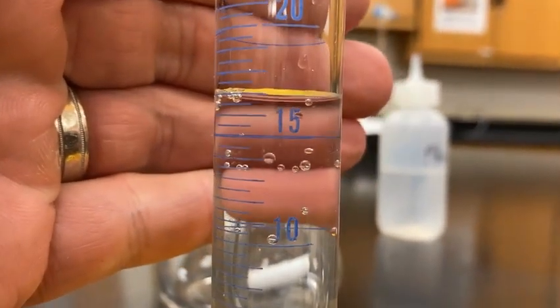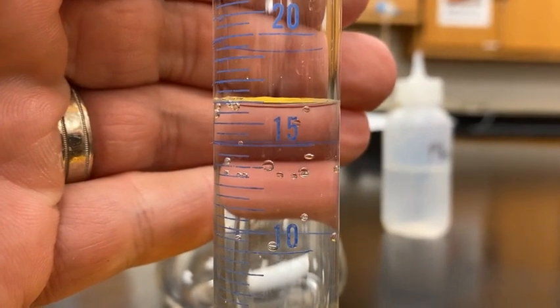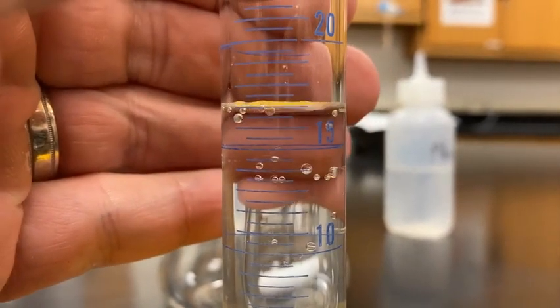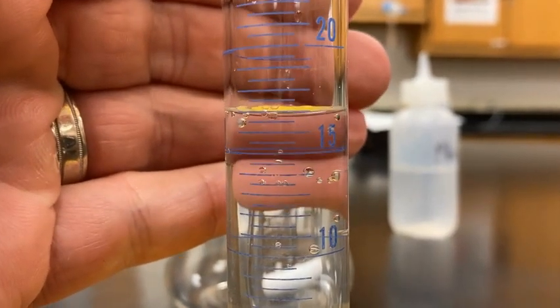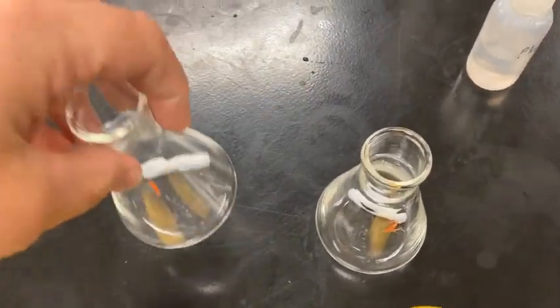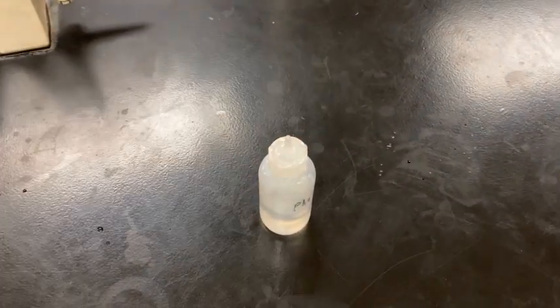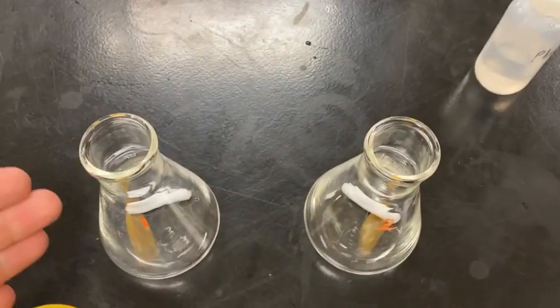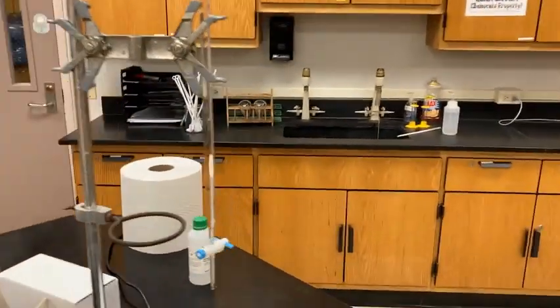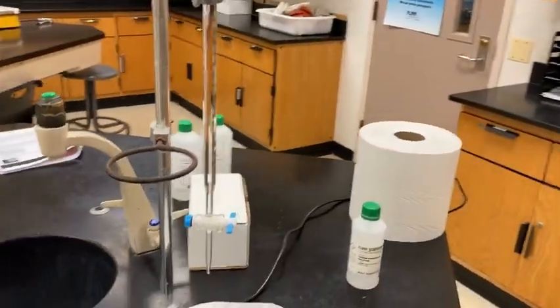Let me get even with it and let you get that measurement. Want me to go like that to help you with the lineup? Okay. Then I'll add those to the 2 flasks that have stir bars in it. Again, a couple drops of phenolphthalein, and I'll add some water just to get the volume up. And then we will still be titrating with our 0.1 molar NaOH that's in the burette.